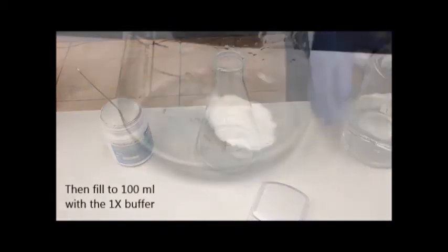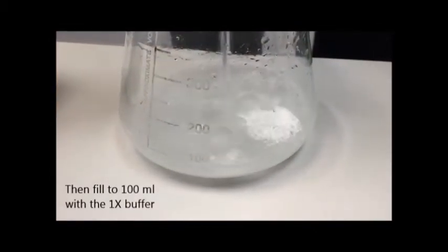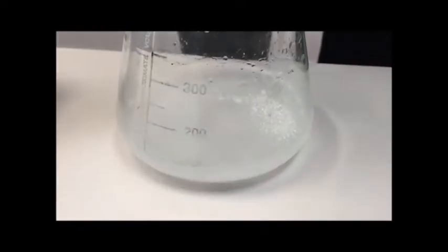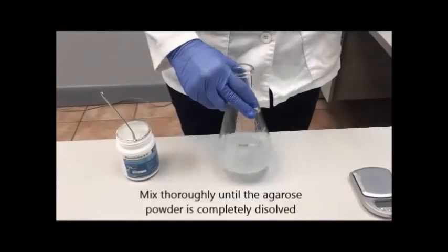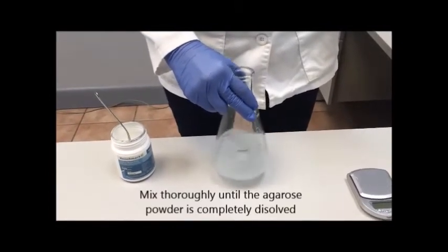Add some of our 1x buffer to bring the volume up to 100 ml. It's very important to mix the solution thoroughly so all of the agarose powder is completely dissolved.